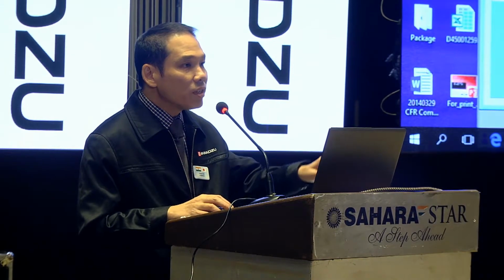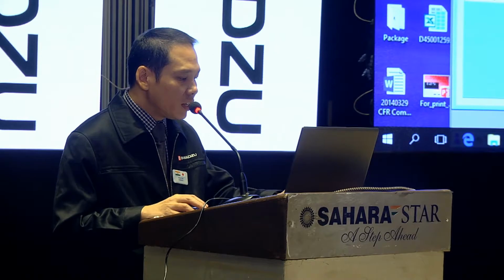So you can enter your sample name, sample ID, sample type. The operator is Sanjay Mehta. So it is registered here. Nobody can manipulate it. I can't even change the name here. That means this weighing is only registered with this user. You can change the sample name or other fields, but you can't change the user. So this is a security feature.